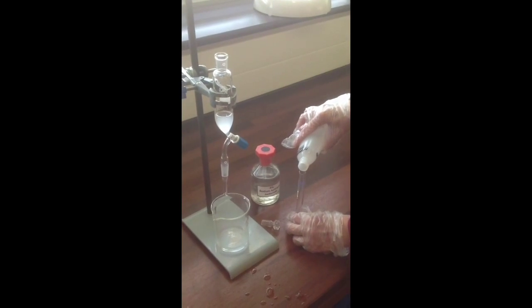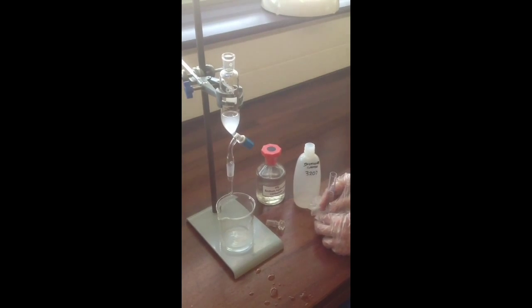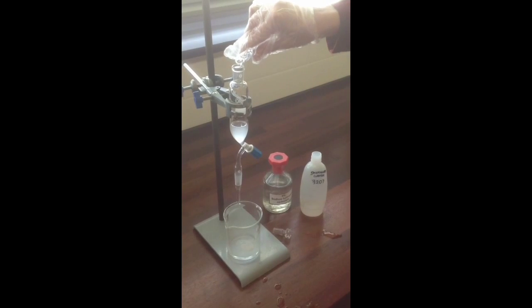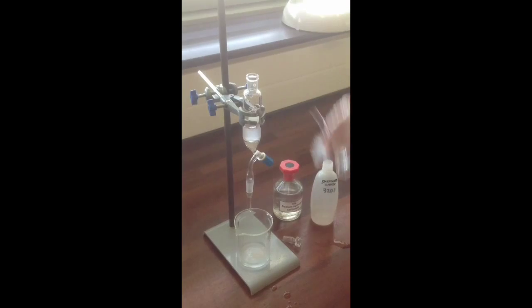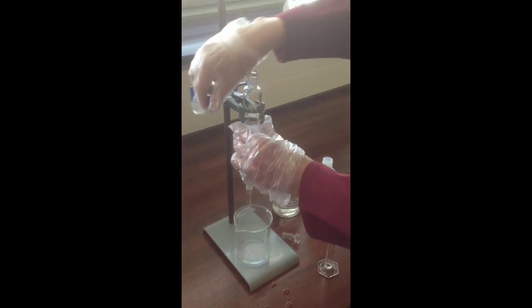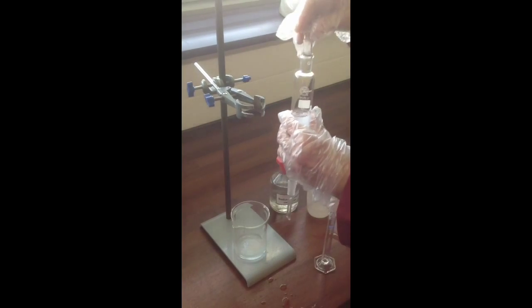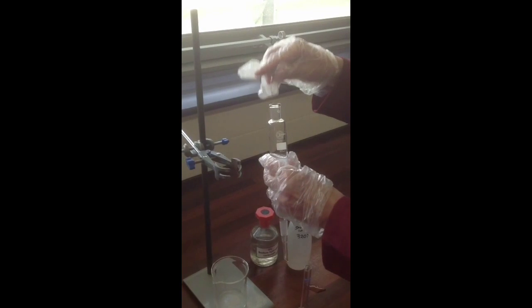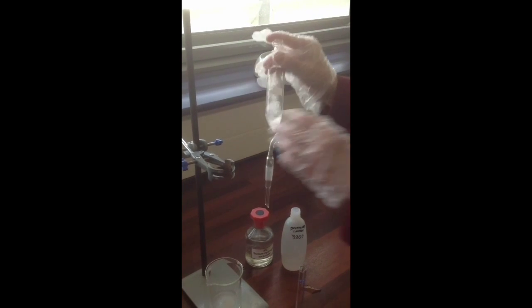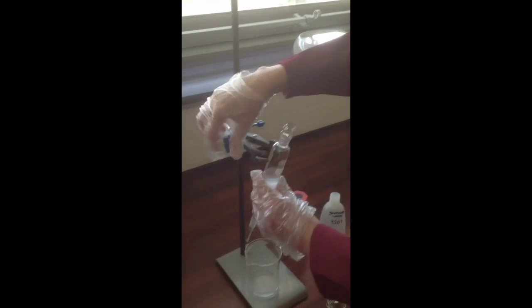We can then do a final washing of our product with distilled water. So again, approximately 10 centimeters cubed of distilled water added to the separating funnel, and this just helps to wash out any further water-soluble impurities from our product. Stopper the flask again, shake the separating funnel again, release the pressure. Not much should form this time, but still just to be safe, a few times before leaving the layers to settle.